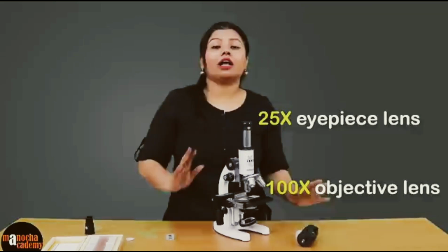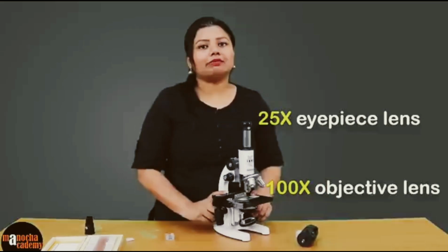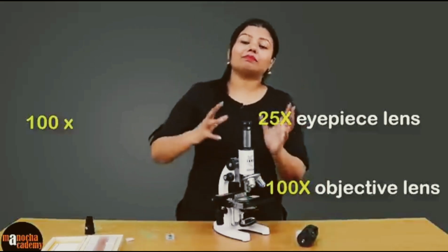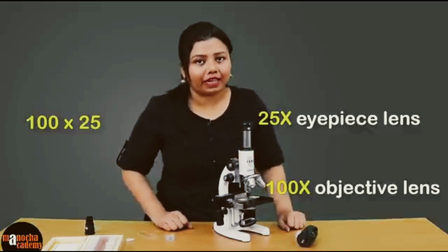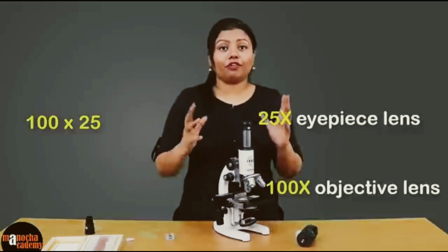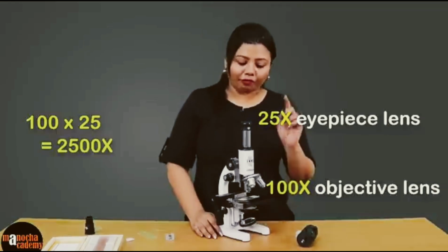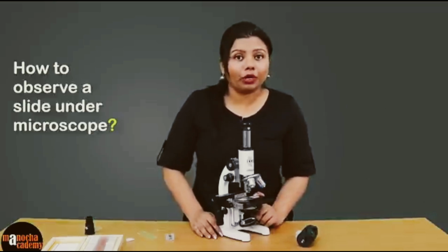So if I am using 100x and 25x, then first the specimen is magnified 100 times, and then that 100 times magnified image is magnified another 25 times. So you are getting overall a magnification of 2500 times the actual size of the specimen that you see here.